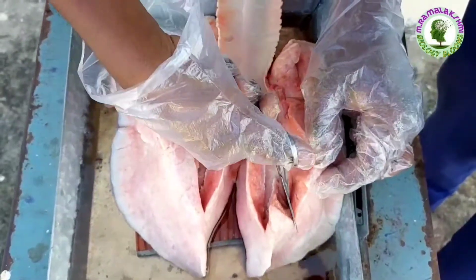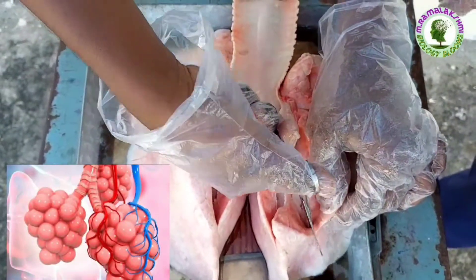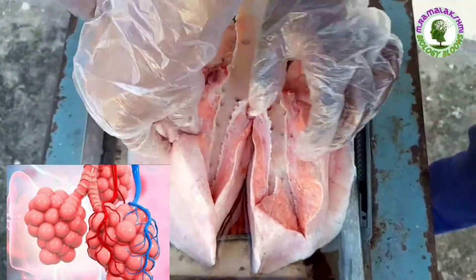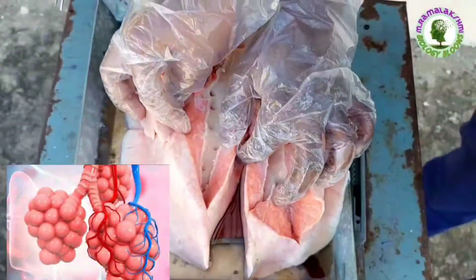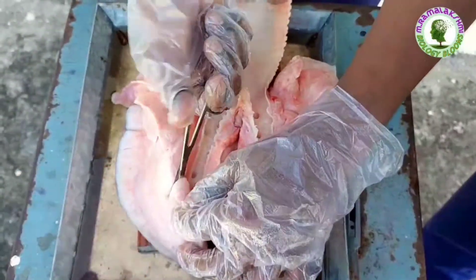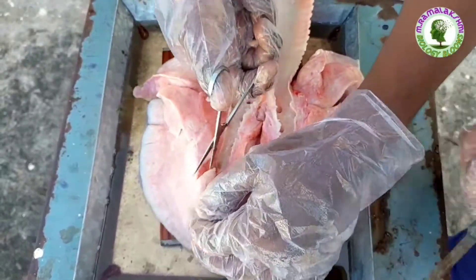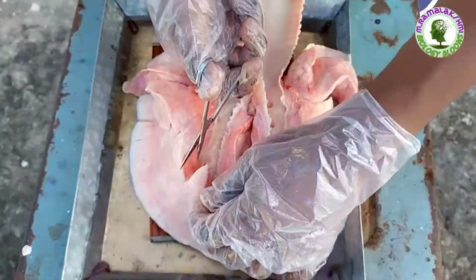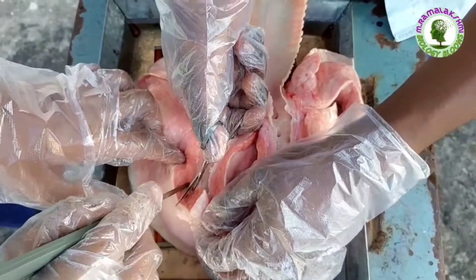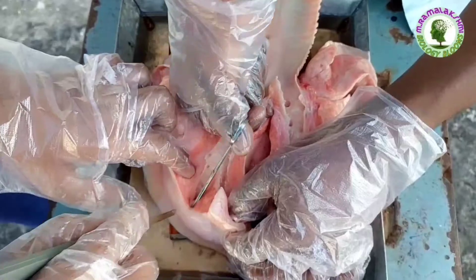These all branches end with specialized cells which are the structural and functional units of lungs, named alveoli. Exchange of gases between lungs and blood occurs here. Now we are observing bronchioles in right and left lungs.